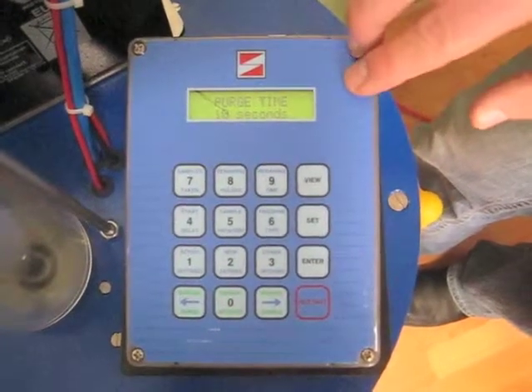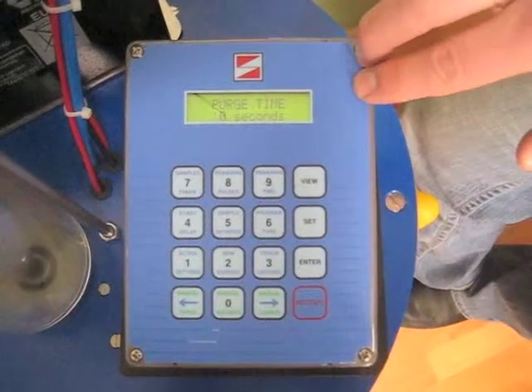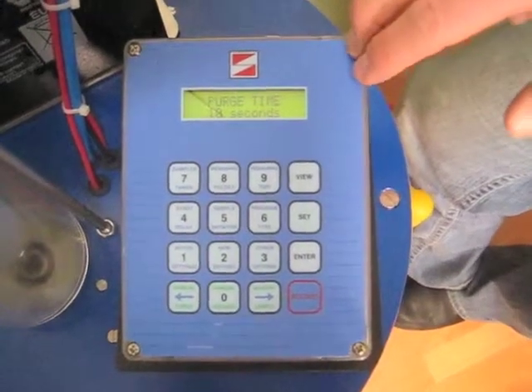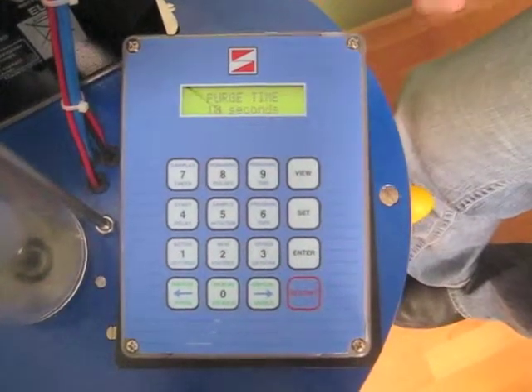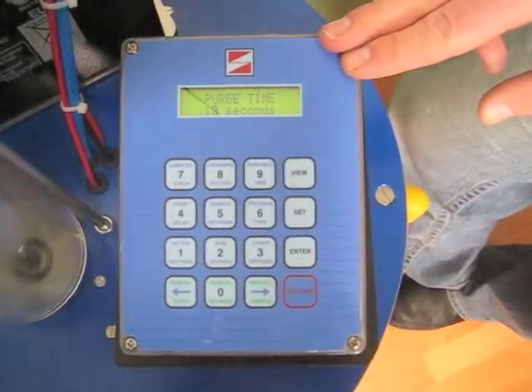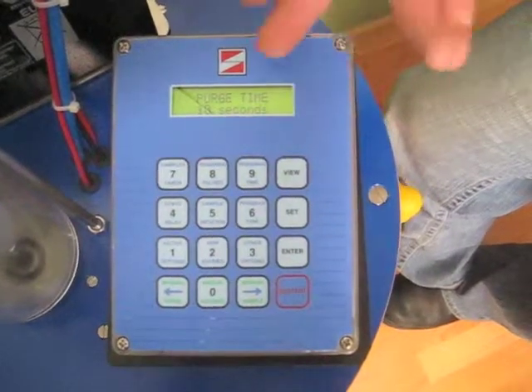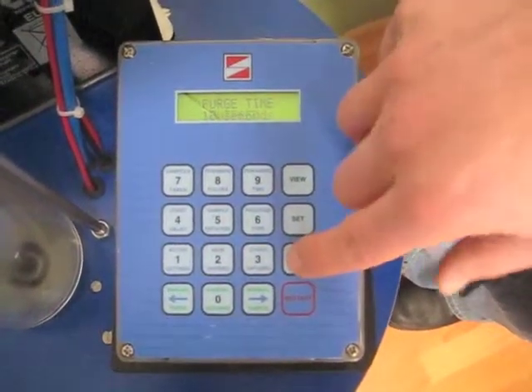Purge time. 10 seconds. For a standard length hose, 10 seconds is a great purge time to leave it at. If you're sampling 250 feet away, you just do the math. You divide 250 feet by 2.5 feet per second. And your purge time needs to be 100 seconds. Or in this case, you'd put in 99. And then so on. Now we'll say 10 seconds and leave it there.